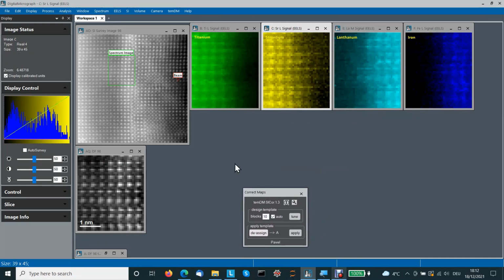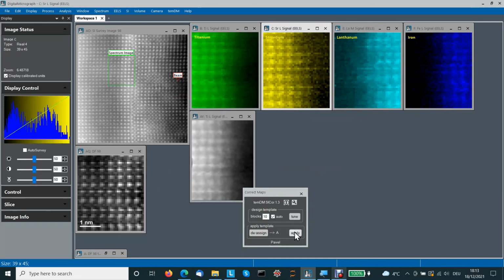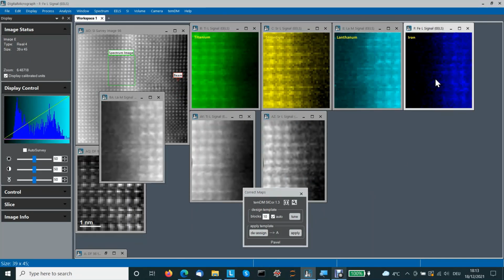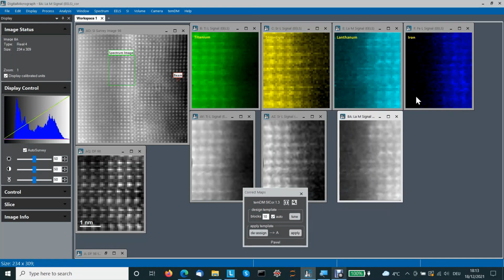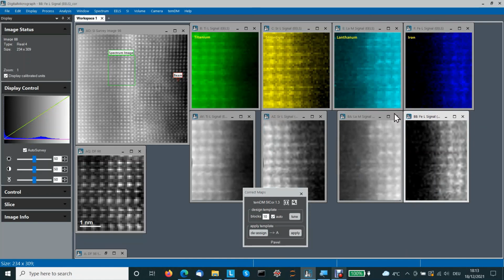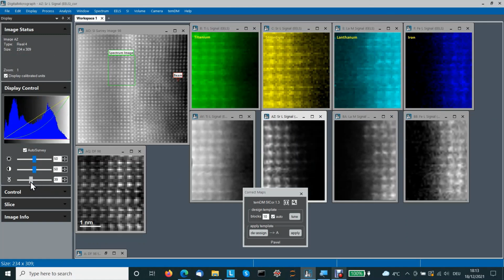Good. Now just click on the corresponding map and press apply. We corrected the titanium map already, then the strontium map, then the lanthanum map, and then the iron map. Good. By default, the resulting corrected maps are displayed in grayscale. You can also change it to color. You can also change the contrast if you want, but that is already another story.